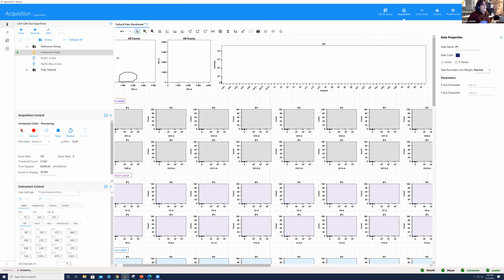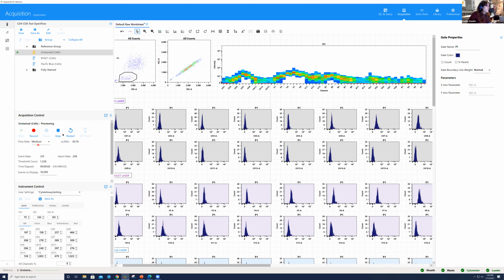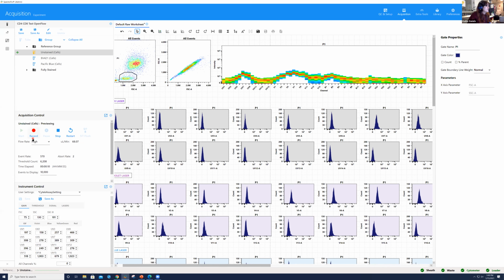Some people might ask the question, how fast can you go, right? Some people might say, oh, I've seen that you can run them at up to 30,000 events per second. I want you to be mindful that as you're running, you want to take a look at the abort rate to make sure it's not too high, right? So you don't want to blast them through too high. I'm still going under 1,000 events per second, so I'm going to change it to high. These are lyophilized cells that aren't too concentrated. And I'm going to go ahead and hit record.